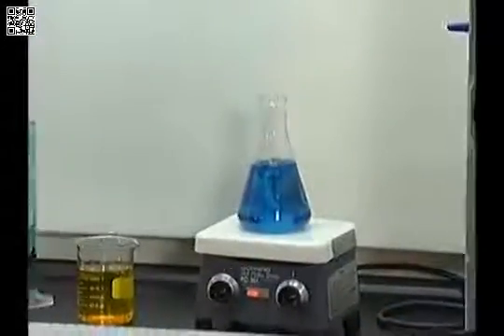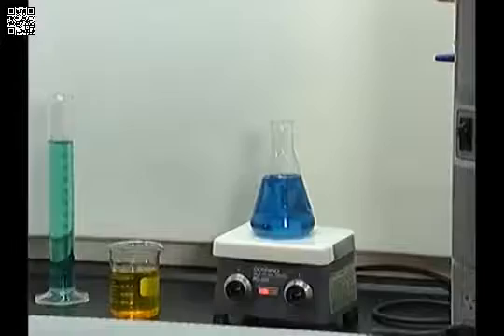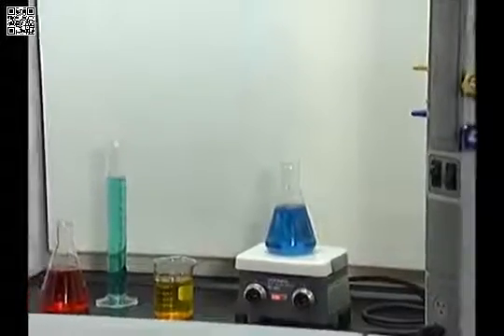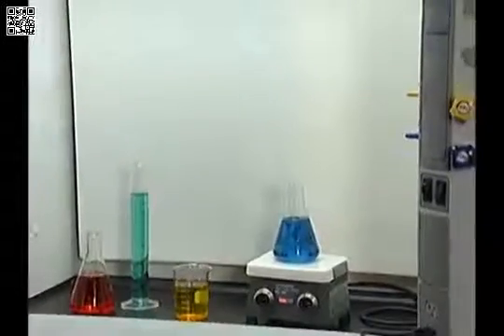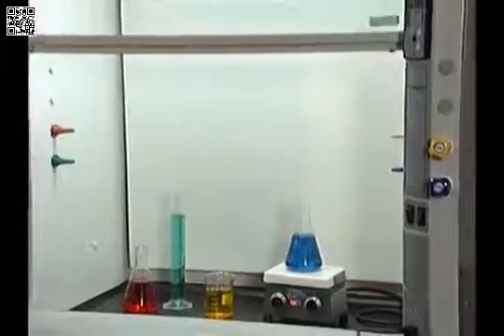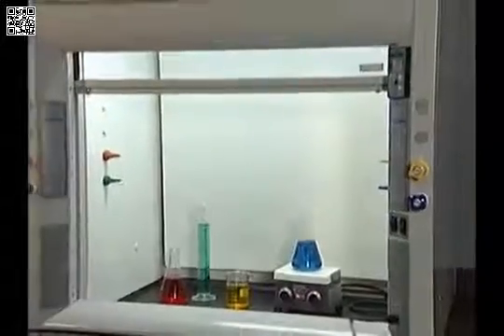A laboratory fume hood is a ventilated enclosure where harmful materials can be handled safely. Air flows into the hood to capture and contain contaminants, preventing their escape into the laboratory.